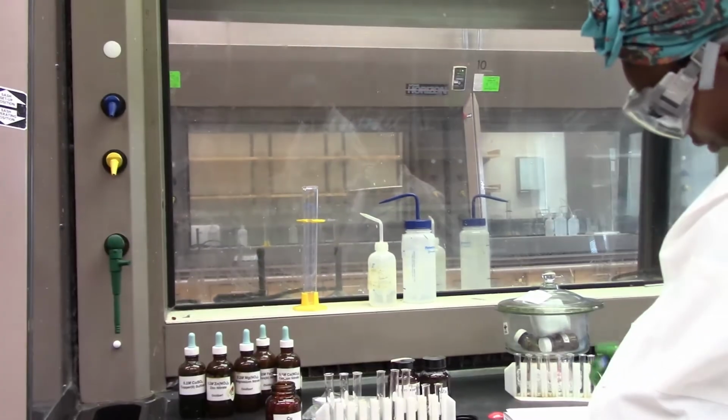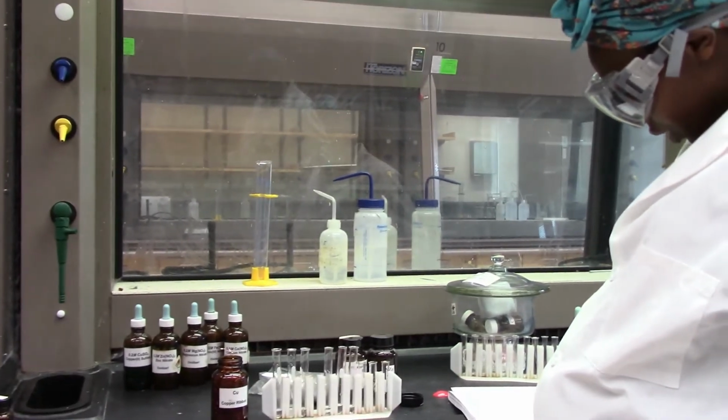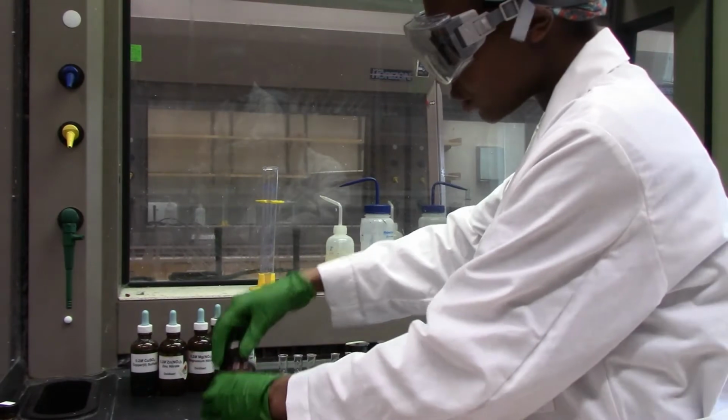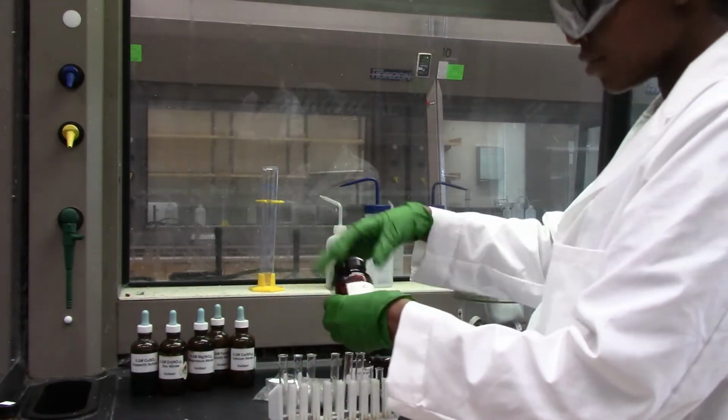So this is copper in HCl, and it looks like nothing special is happening. So you should be able to tell why this metal is just sitting in the HCl. For example, I would record that as no reaction, or however you want to classify it.